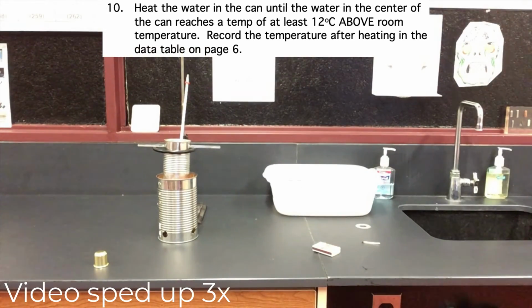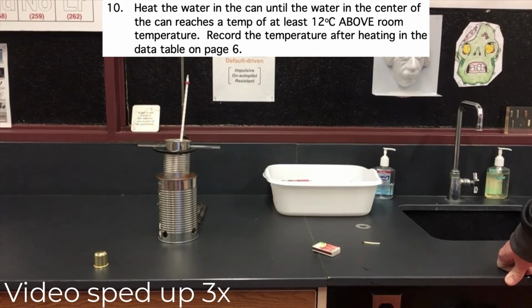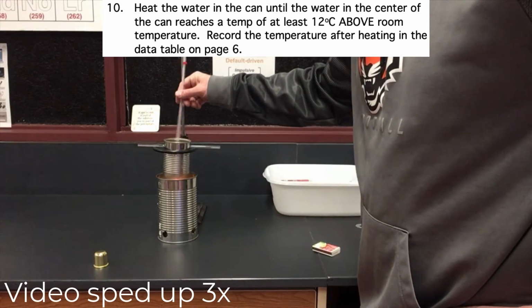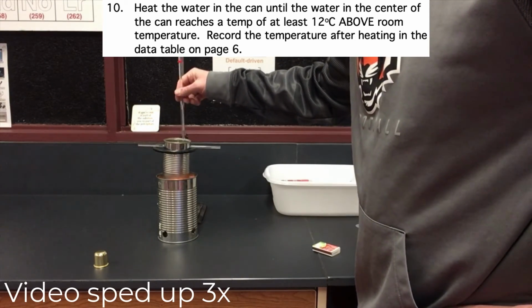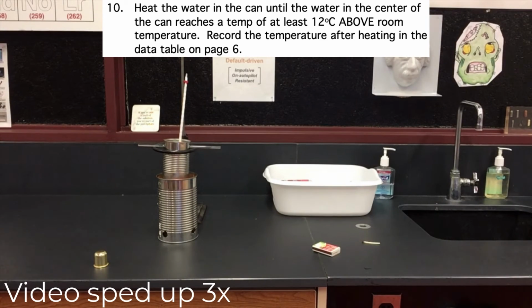We will continue to heat the water inside the can until it reaches a temperature about 12 degrees above that room temperature that we recorded. Remember, we are assuming that all of the energy released by burning the ethanol fuel is absorbed by the water in the can. That is going to allow us to determine the heat of combustion for ethanol.